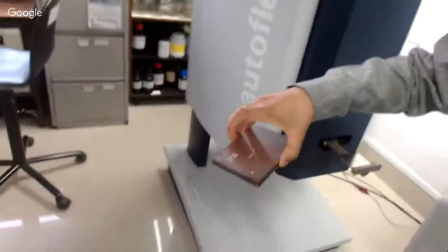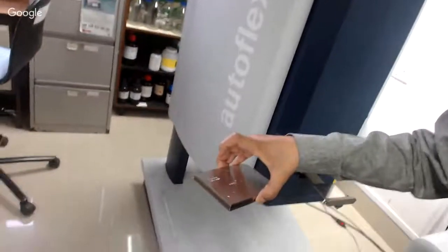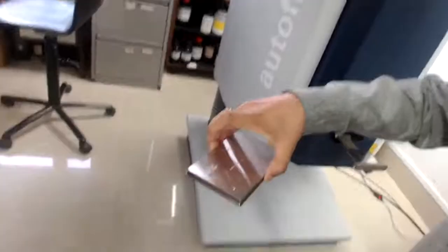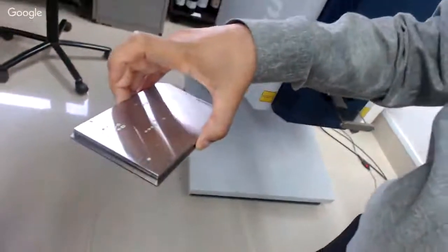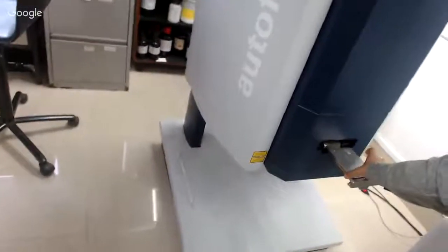All right, I'm trying to be a little hands-on and show you more detail about the instrument. This is a MALDI plate on which you can put your samples of interest, and you're going to see that in much more detail. Then you place it inside this particular slot to insert the plate. After that, everything is pretty much software operated. So let me go back to my position.